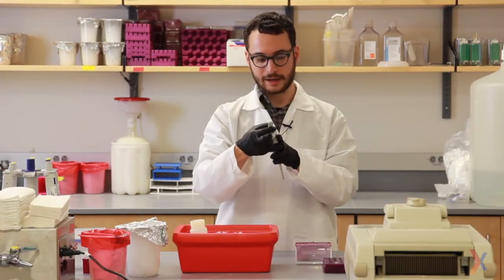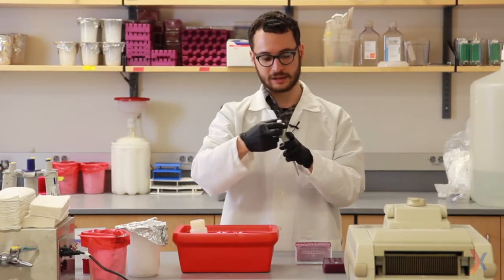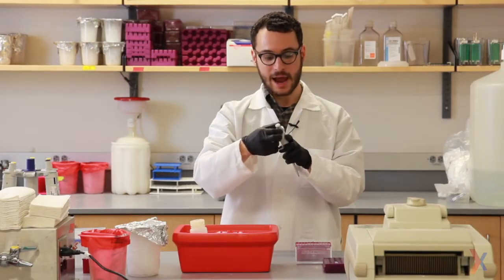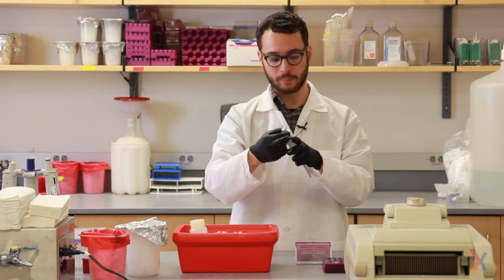Next, I'll be adding the PCR buffer. This buffer contains Tris-HCl and KCl, and it's meant to stabilize the pH between 8.3 and 9.